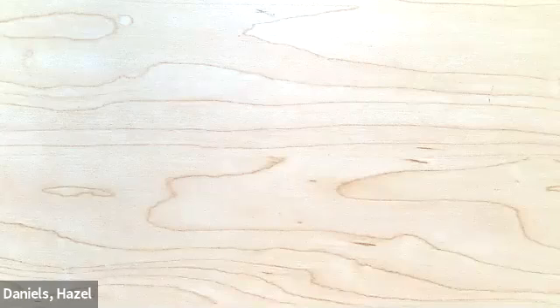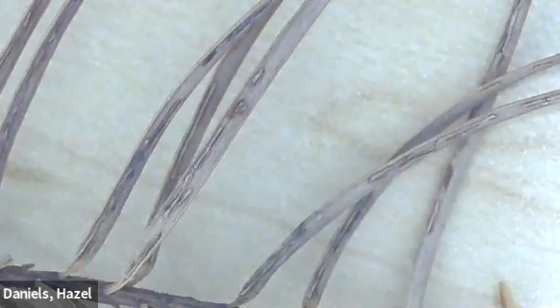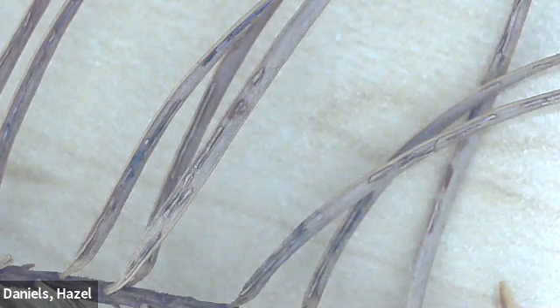And this one, like it says in the name, is a disease of Douglas-fir, causes some discoloration on the needle. And I'm going to just skip straight to the magnification here. So this is an older sample, so the needles themselves are not green like you would see in the field, but the fruiting bodies here are still very visible. So like I said, this is an ascomycete.